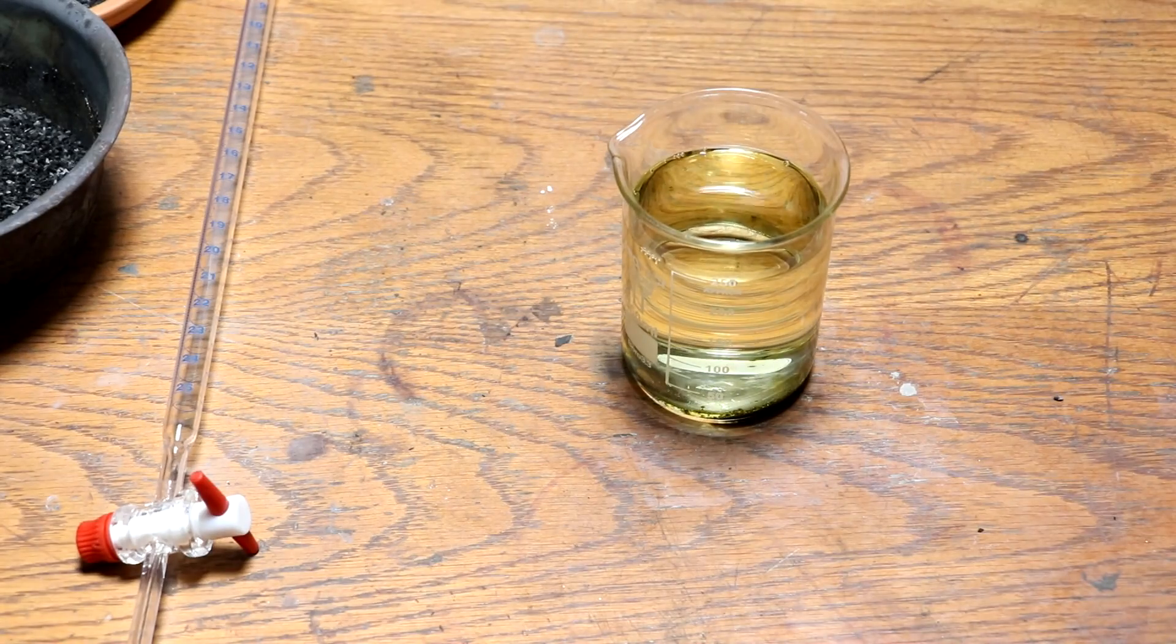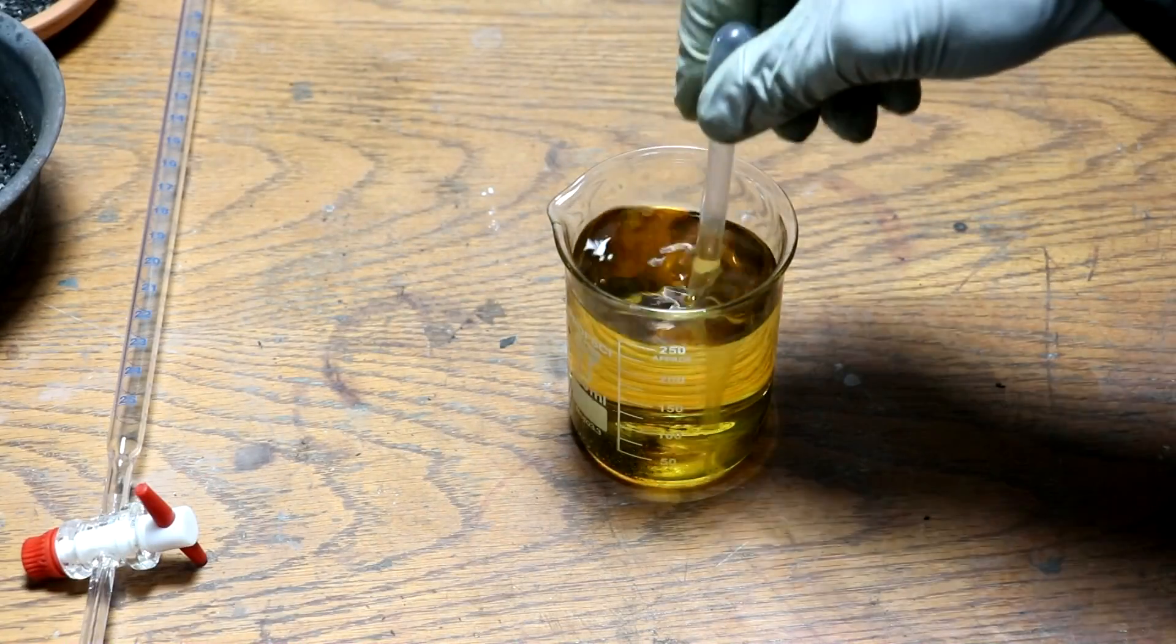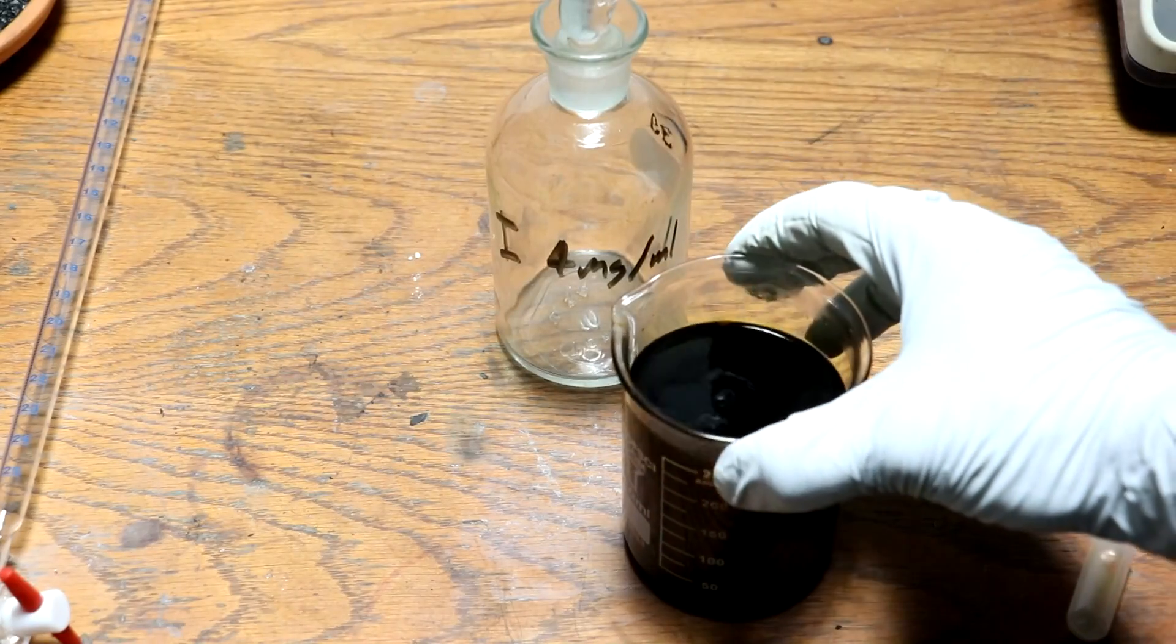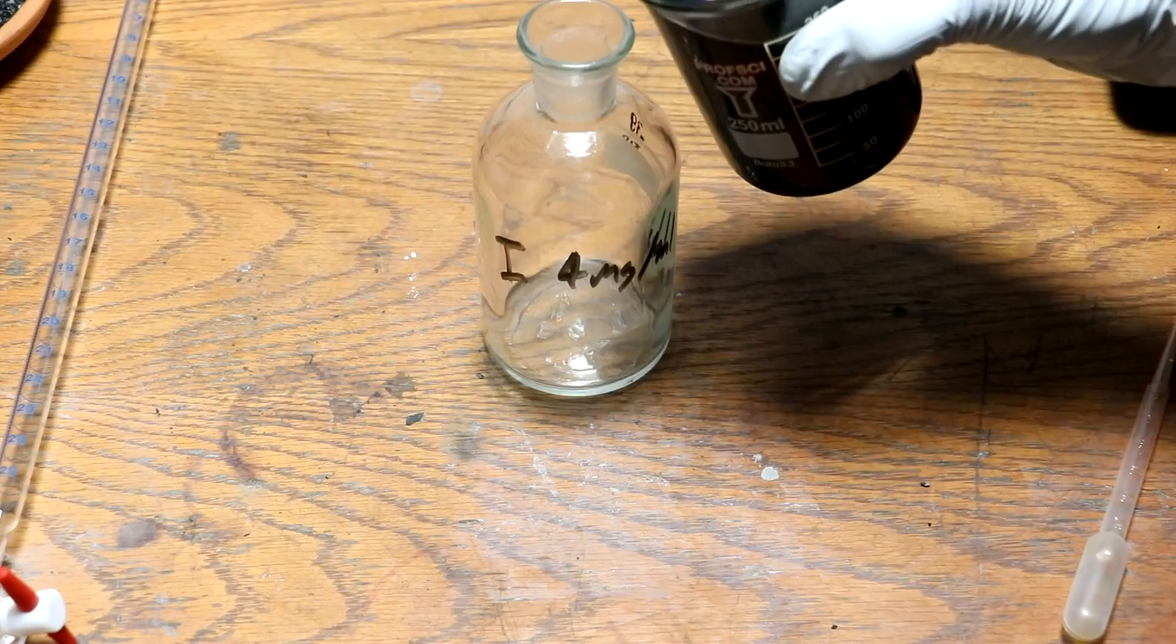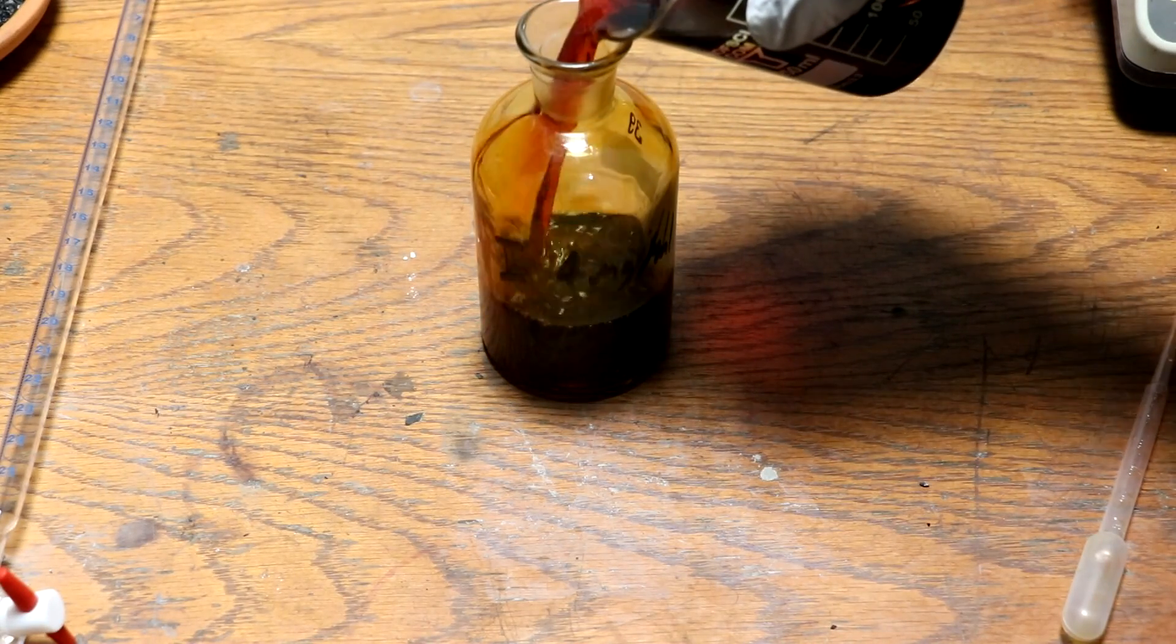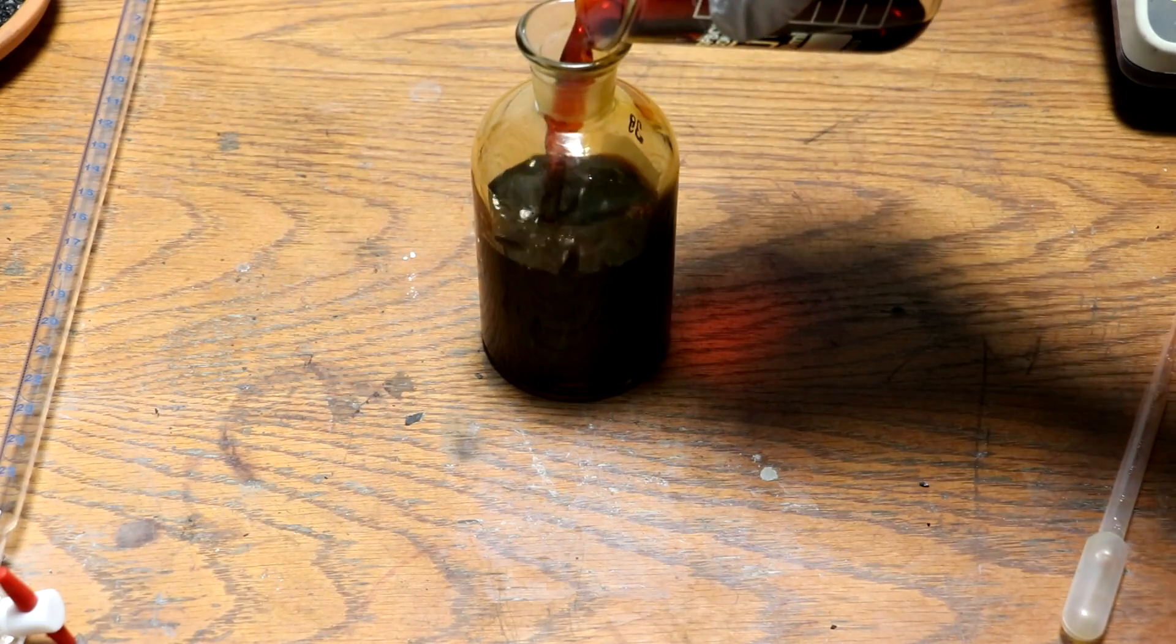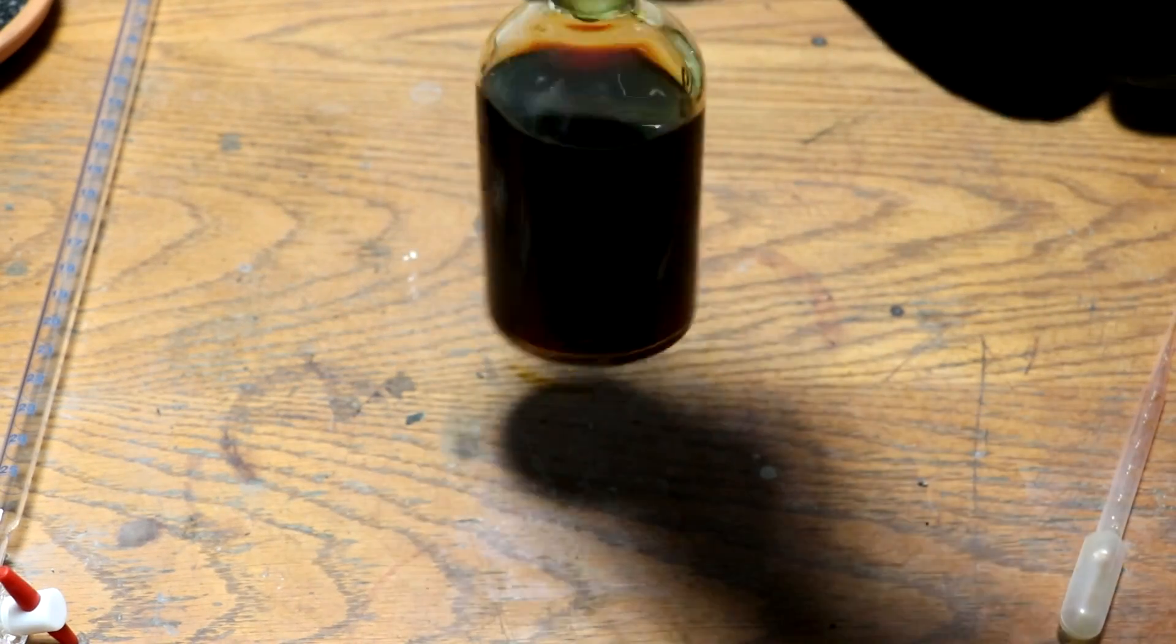That's a lot of alcohol. Get that dissolved up. So the iodine is all dissolved. I'm gonna pour this over into another container just so I can have a lid on it so we don't lose anything due to evaporation. It has four milligrams of iodine per milliliter.